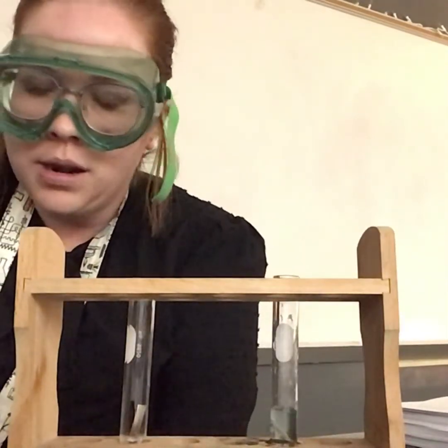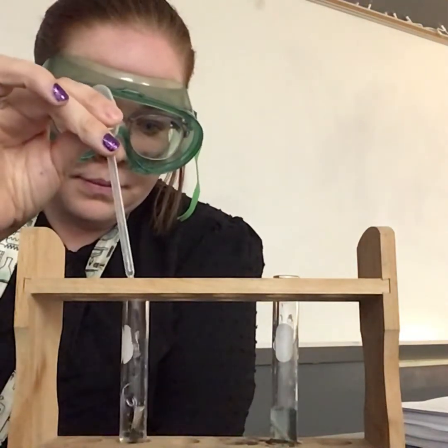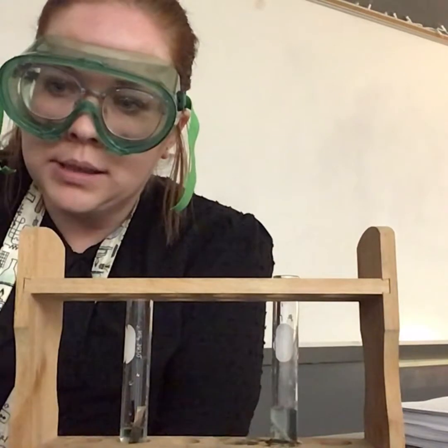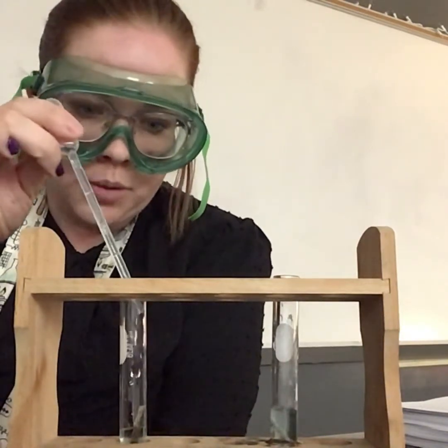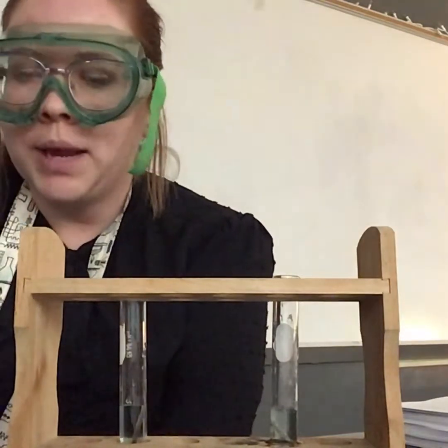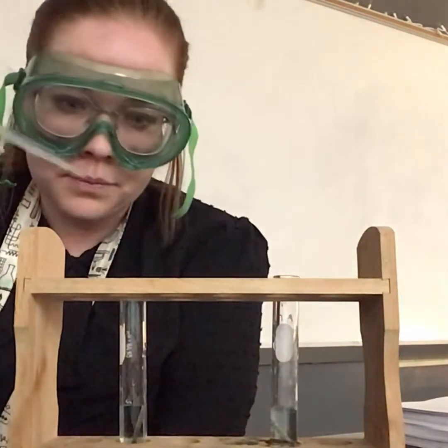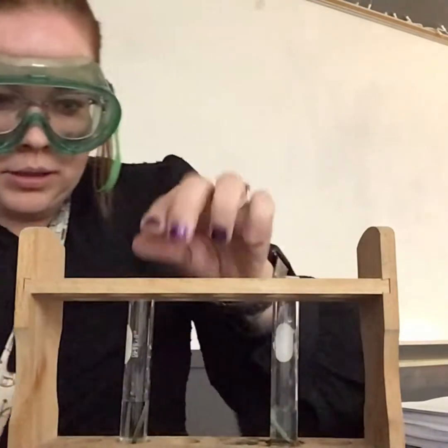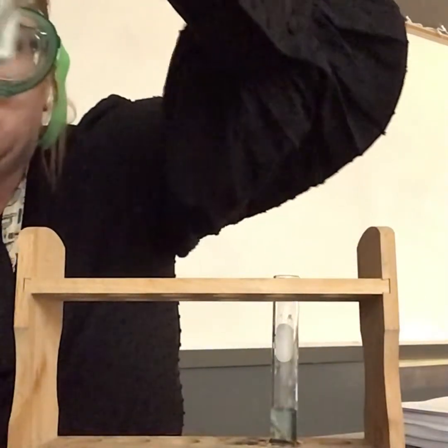I'm going to leave that there and we'll come back to it. This one is silver, so let's add our copper chloride. Copper chloride is toxic - it's mildly toxic, it's harmful - and that's why I'm wearing these safety goggles. I'm going to make sure to wash my hands when I'm done. Okay, so in this test tube I have copper chloride and silver.